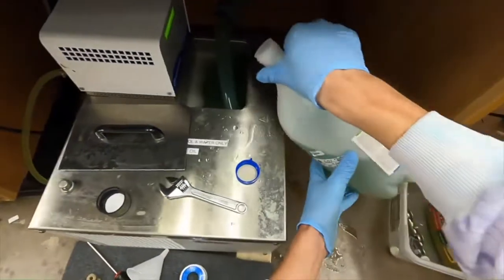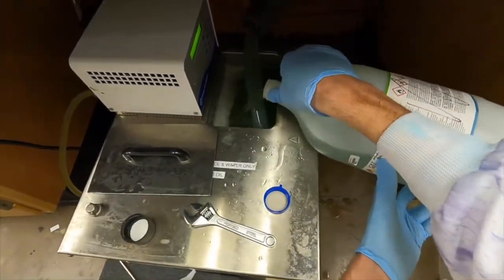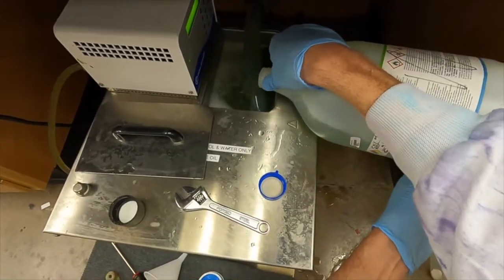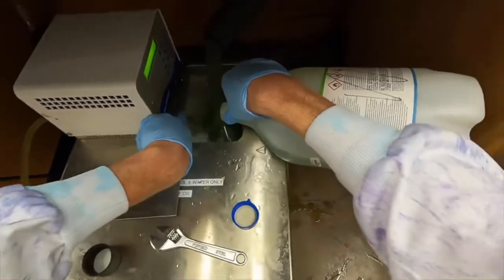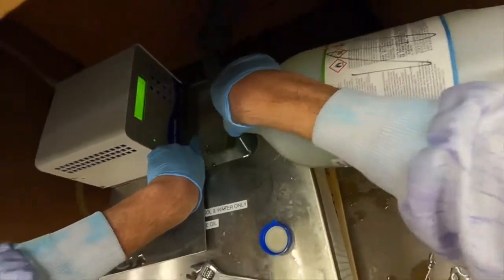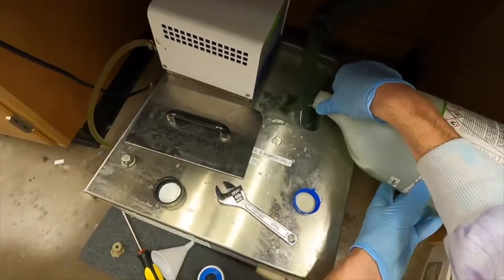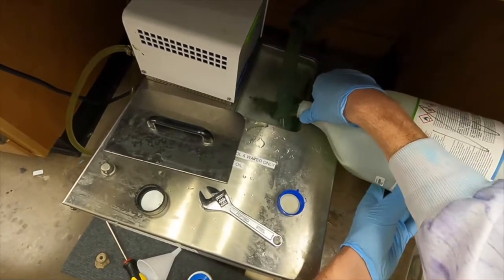It usually takes all of this O'Reilly's bottle and then a little bit of this one. I don't know how easy this is to see, but there's this little line right here - this top little gap - that's kind of the top fill line. You want to keep it close to that but not over that.